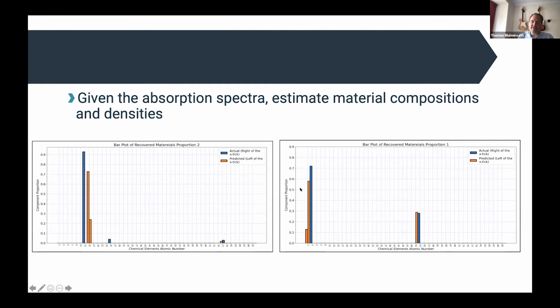Once we've estimated the spectra, we can then estimate the materials within these pixels. The estimates are here to the left and the true ones are to the right. The estimates are actually shifted one element here just to visualize it better. These are nearly correctly identified, just the proportion of this material, I think it's element 52, versus element 3. So element 3 is slightly underestimated. Element 52 is slightly overestimated in terms of proportion or density.